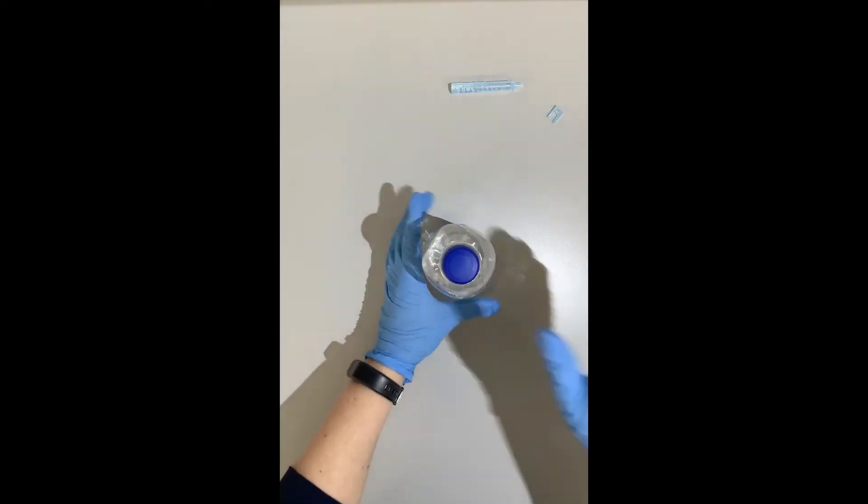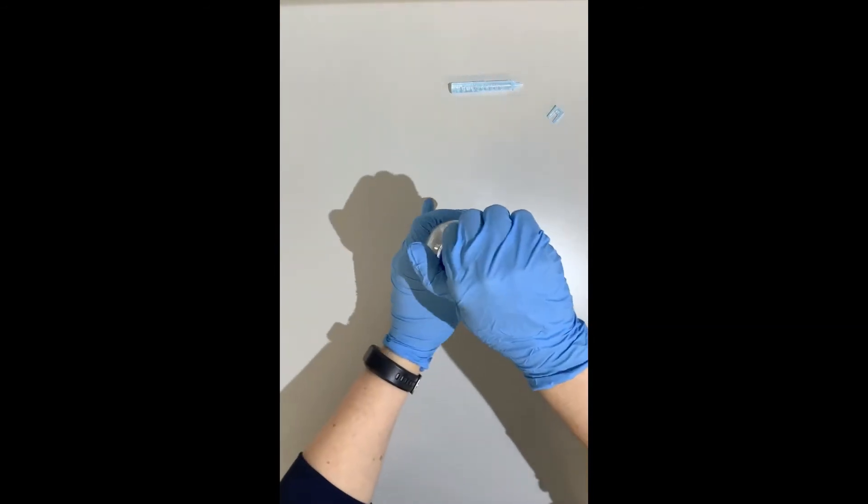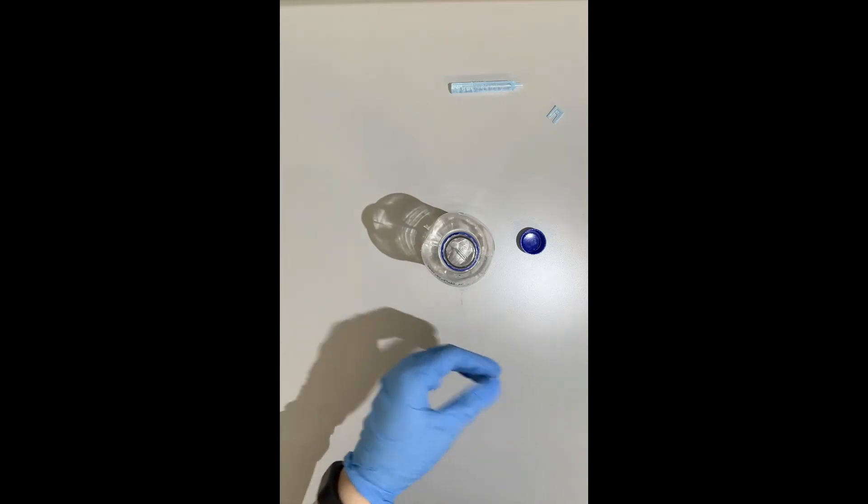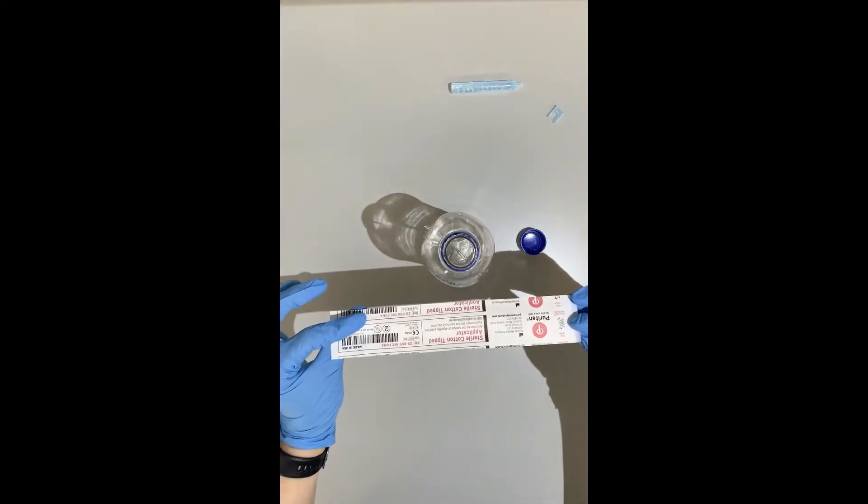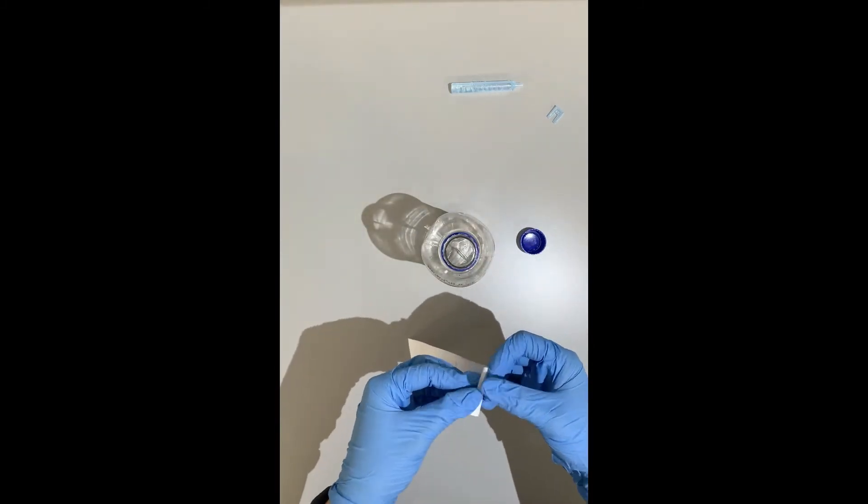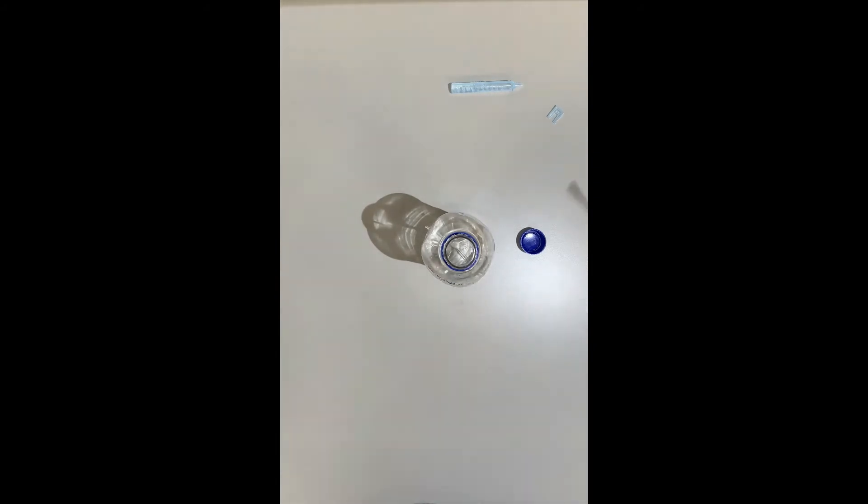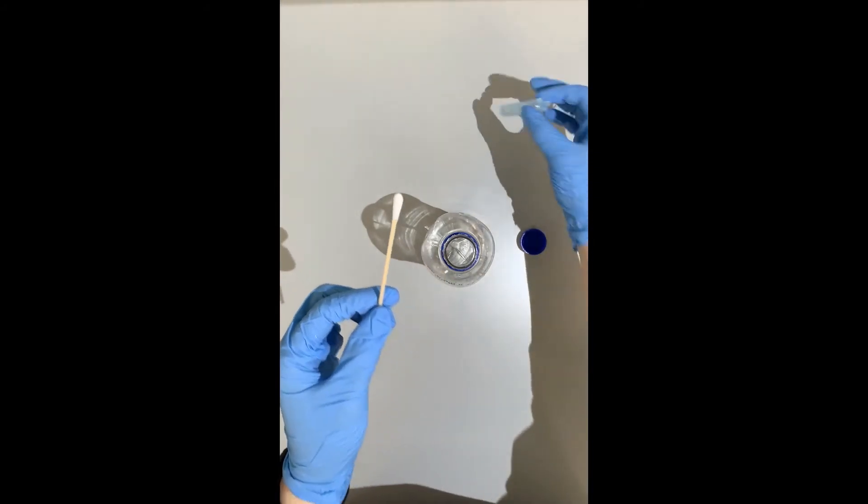You want to, of course, with gloves on, open up your cap. I have my cotton swab and I'm going to use one swab for this. I'm going to open it up and using my sterile water.